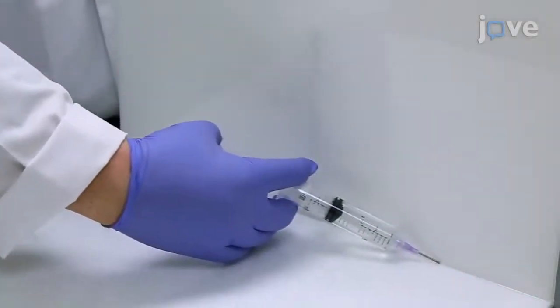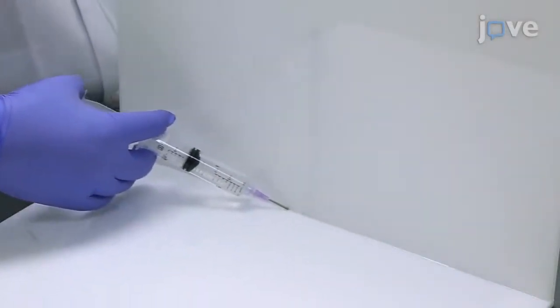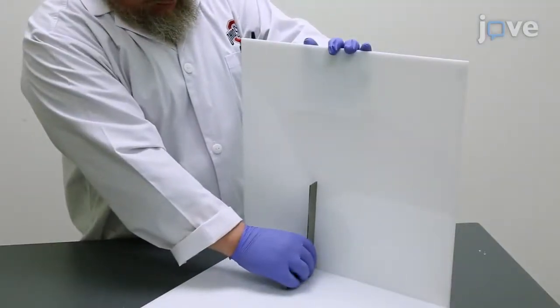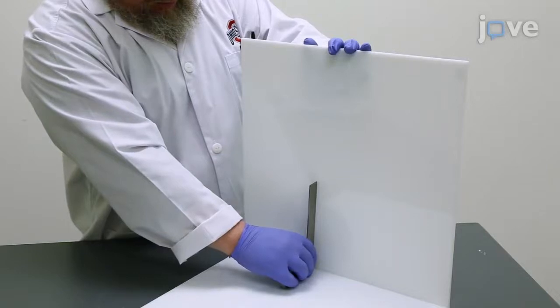Then, use the syringe to apply a small and steady bead of cement directly to the corner of the two pieces being joined. Hold the two pieces in place for five minutes until they are initially set.